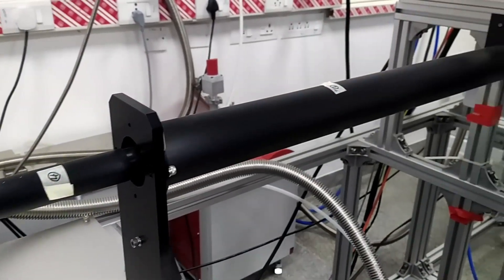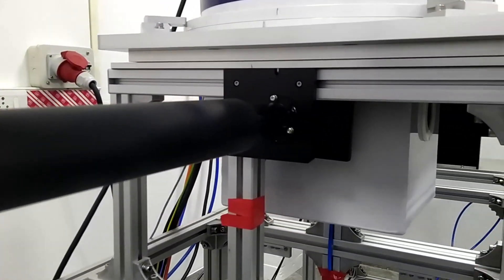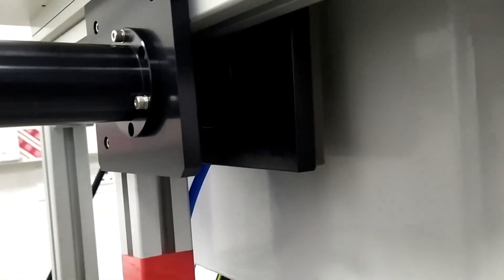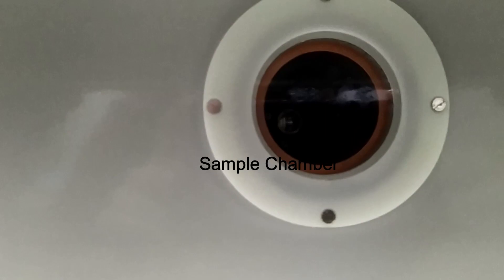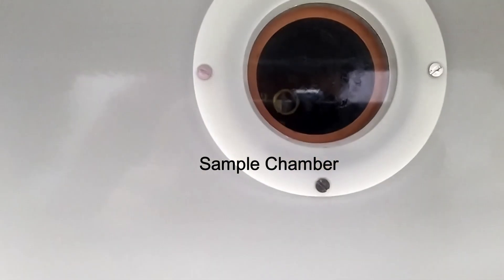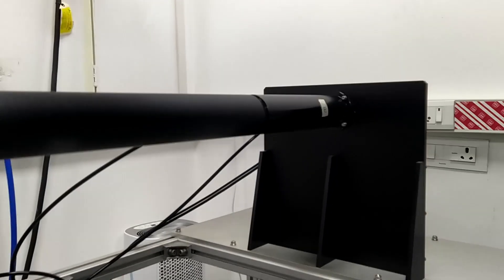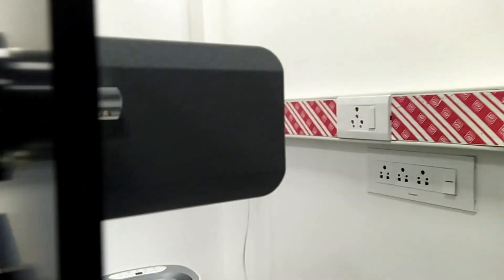In this instrumental setup, we measure the sample absorption under a high magnetic field. This is how the light travels through the optical path, and this is the sample chamber. It illuminates the sample through one of the quartz windows, as shown here. After transmission through the sample, the light passes to the other side of the magnet via this optical path through the detector.